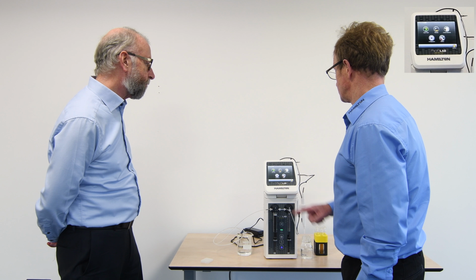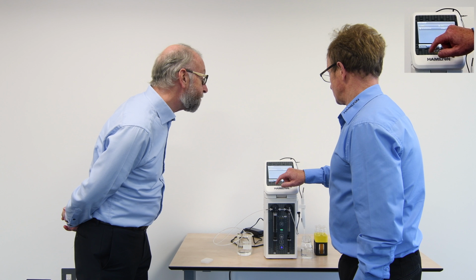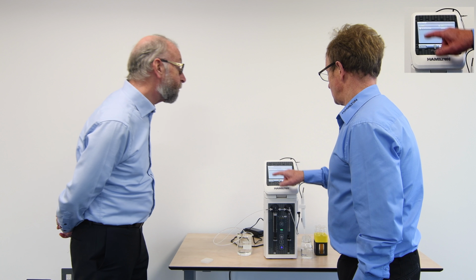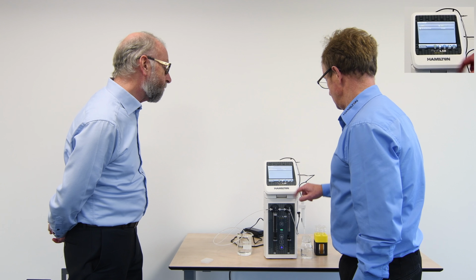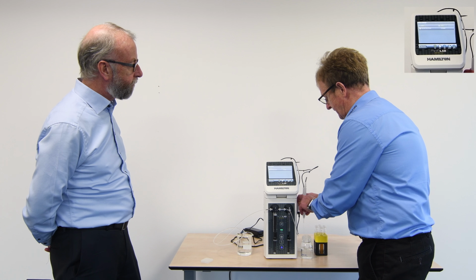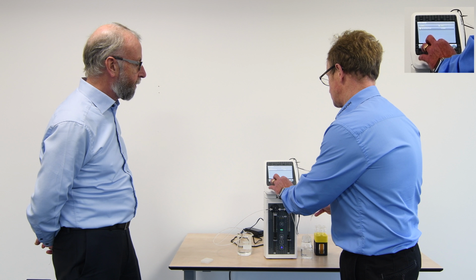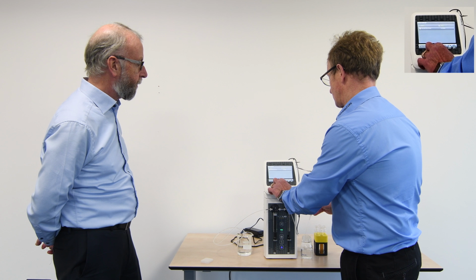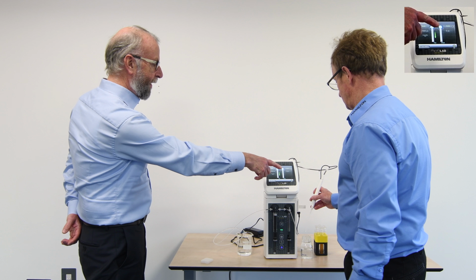So I'm going to actually go into custom programs, and we've got a TriCAD dilution. So if I highlight this, and there are several programs, I can select run from this button here, or from our probe on the front, as we've seen on the previous steps. So we've initialized this, so we've gone into this particular program and gone to run step. So once I've selected the program, everything's controlled by the hand probe.